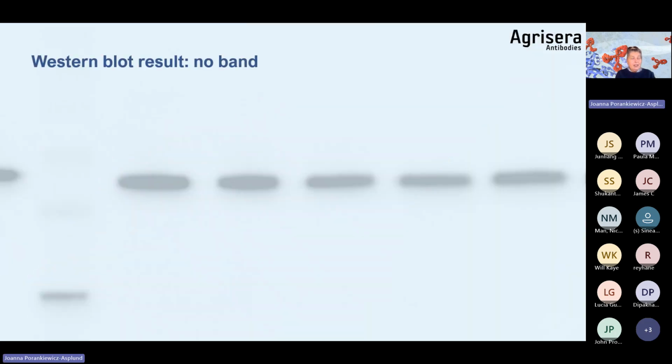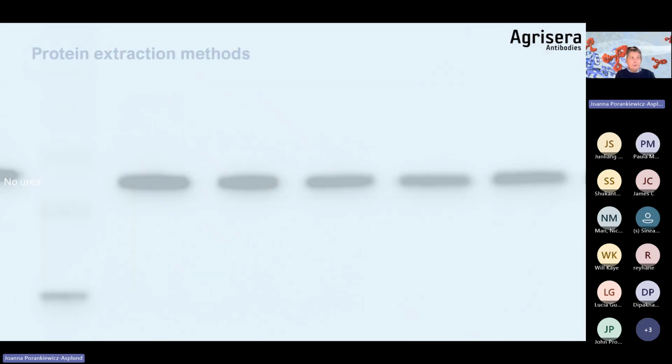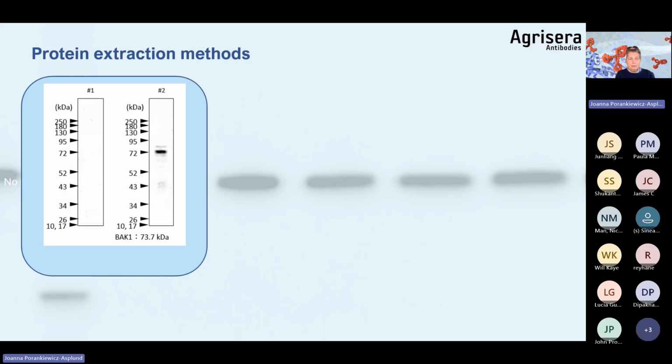And as you know, in some cases we may have such an outcome. There is no band whatsoever, and there can be different reasons for it. For example, the extraction method. As you see in this example, which was sent from one of our test labs, depending upon which extraction buffer was applied, the target protein band was detected. So you should never discard an antibody directly if it doesn't give you the desired outcome.